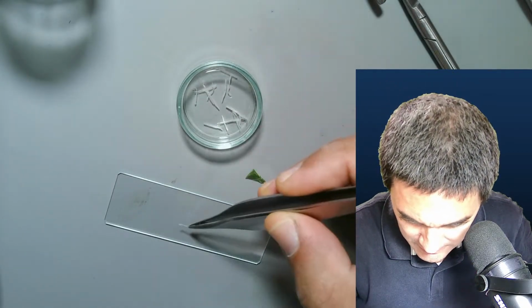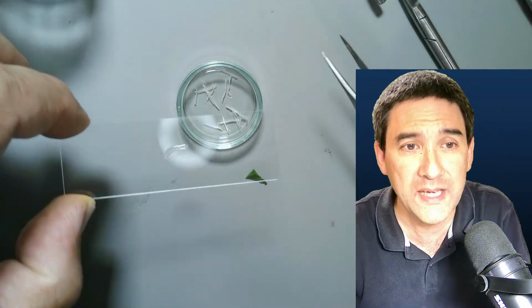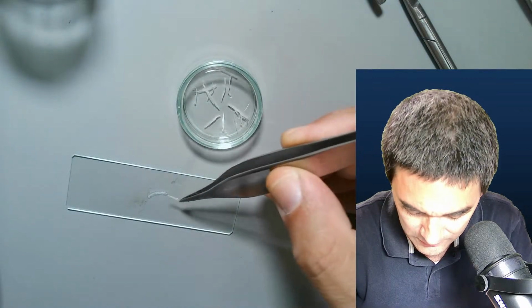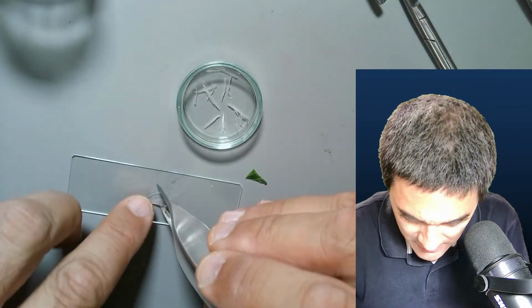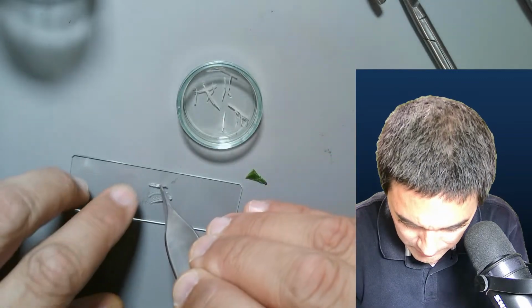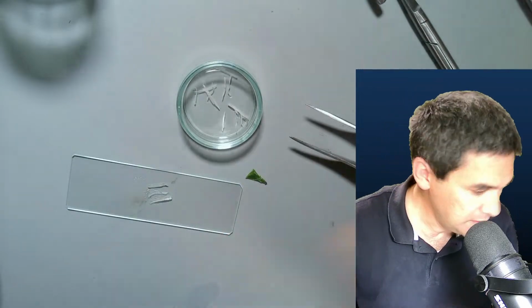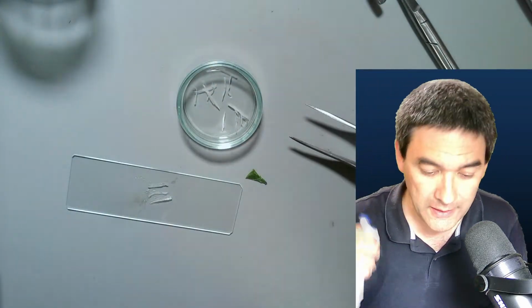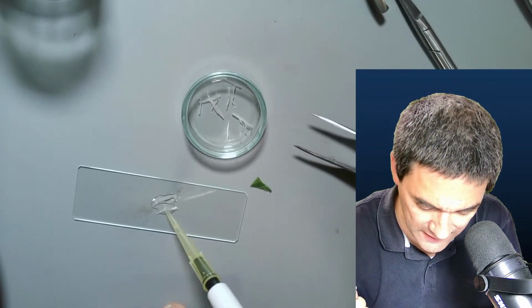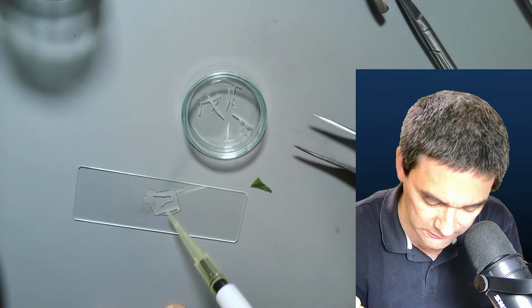So when I put them in here, yeah, I can do that. Then there is the danger that when it dries out, it's really going to completely lose its shape and deform. Okay, so that's not something that we want to have. So what I have to do, after I place it on here, is put a few of them on here and add a little bit of water. Again, I'm searching for my pipette here, and the water will prevent the leaf from shriveling up.